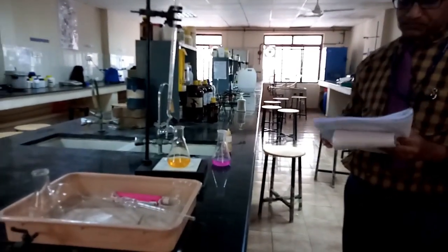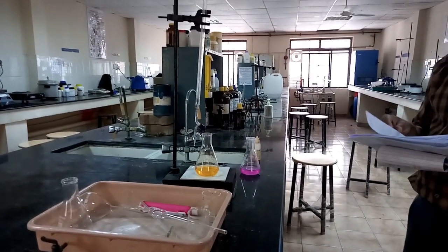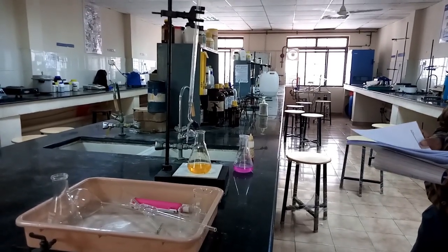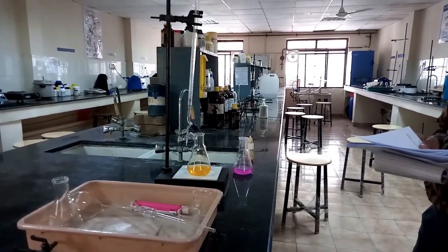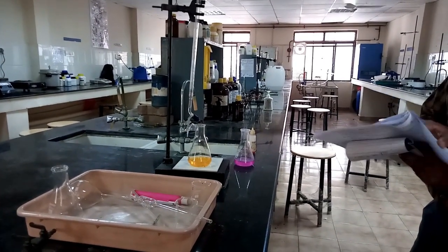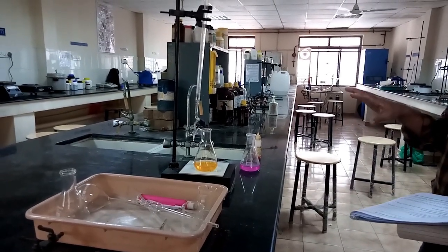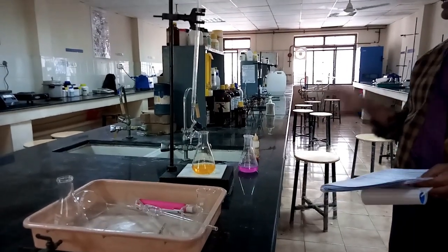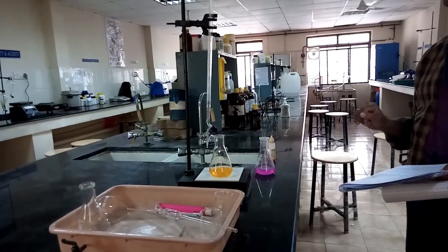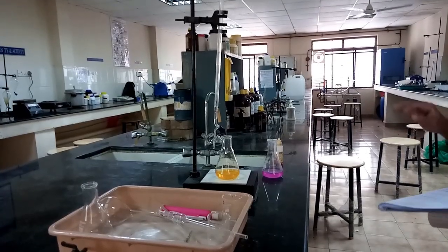So this is for alkalinity, and you represent whatever alkalinity is present in the respective samples as mg per liter as CaCO3. Similarly, the same experimental procedure is conducted for the tap water as well as the drinking water, so all three samples can be compared.